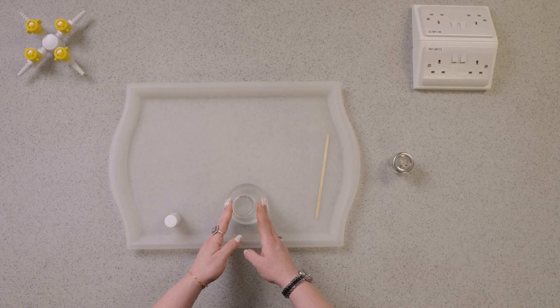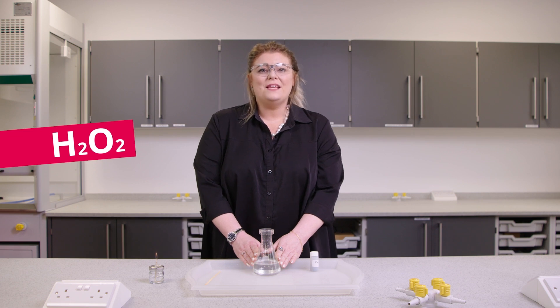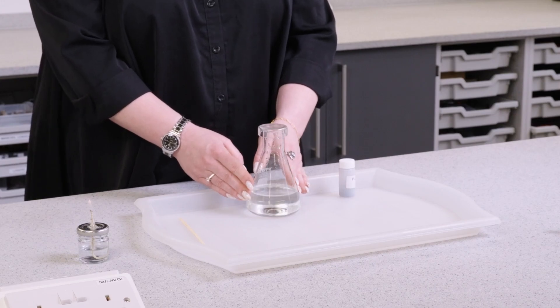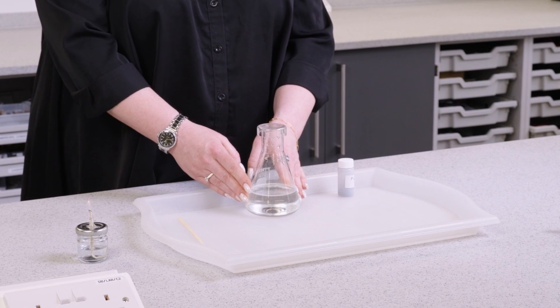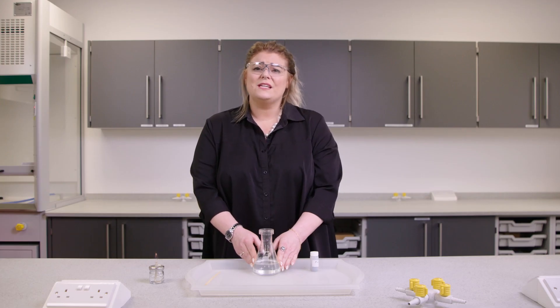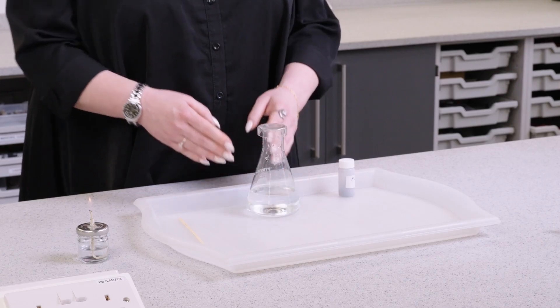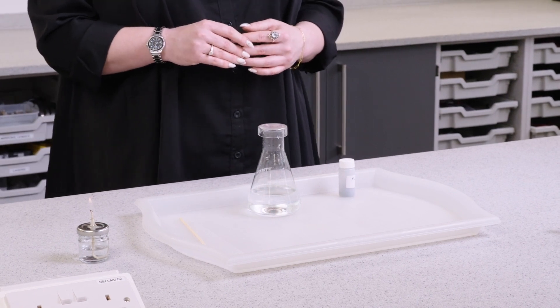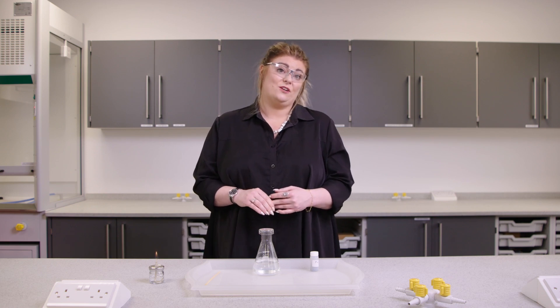Today we are using a chemical called hydrogen peroxide — it has the formula H₂O₂. It looks like nothing is happening, but it is slowly decomposing to water and oxygen gas is being given off. You may have heard of food decomposing, for example in a compost heap in a garden — for matter to decompose it's breaking down into smaller parts. Hydrogen peroxide naturally decomposes into water and oxygen. Can you write a word or perhaps even a symbol equation for this chemical reaction? Take a couple of seconds to have a go, or if you're watching on demand you can pause the video.